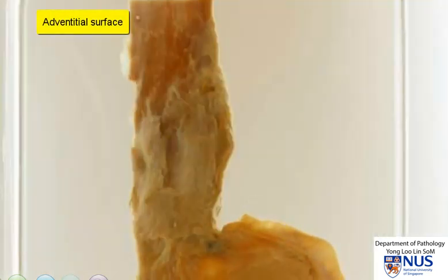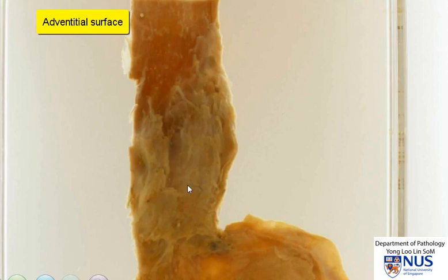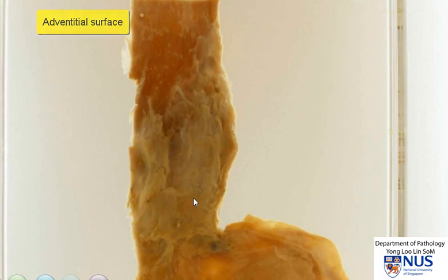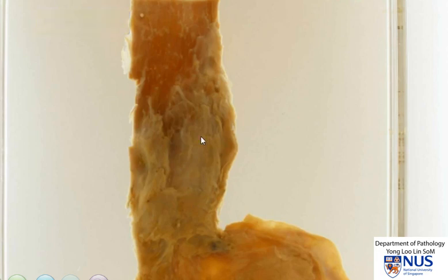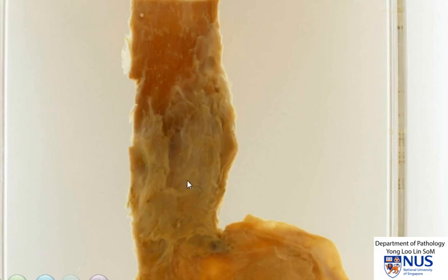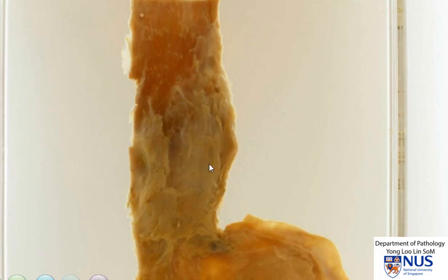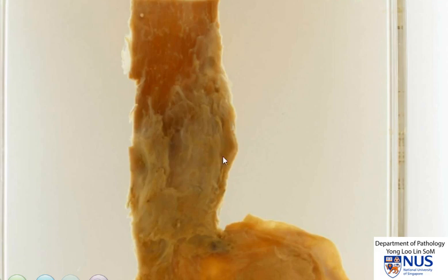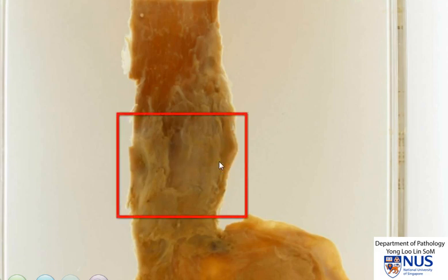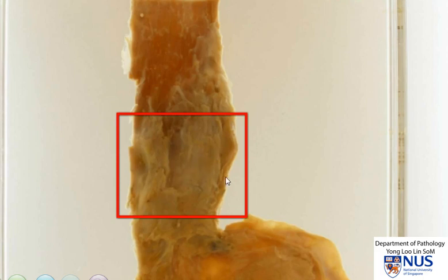In most areas, the esophagus is not covered by serosa on its outer surface. Rather, it is composed of adventitial tissue and this tissue is in contact with the mediastinal structures. So the circumferential surface of the esophagus is actually a surgical margin. Therefore, it is very important to sample these areas and examine them under the microscope to see if the tumour goes all the way to the outer or circumferential margin.